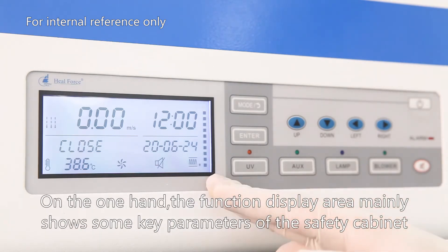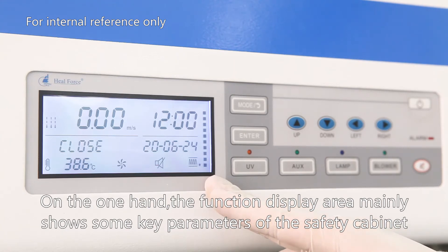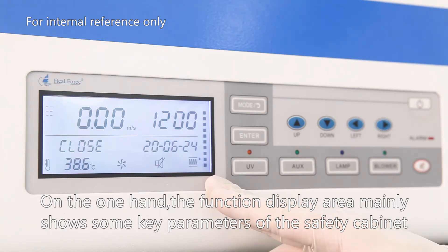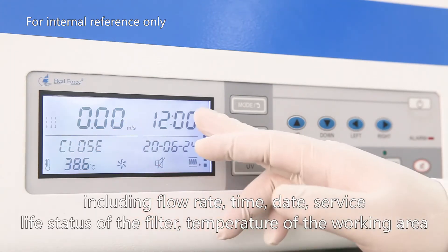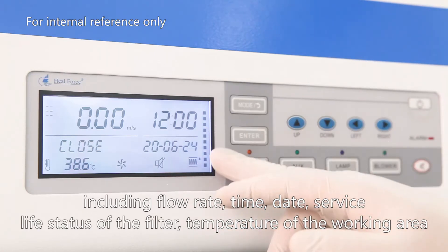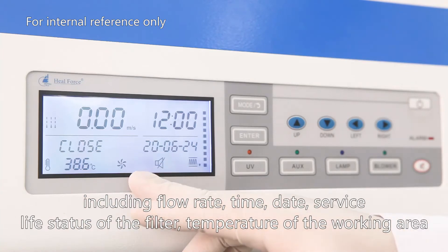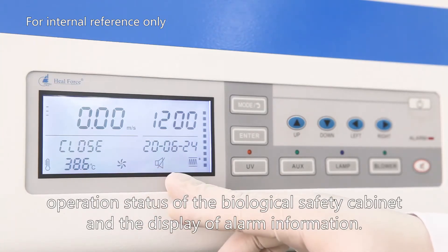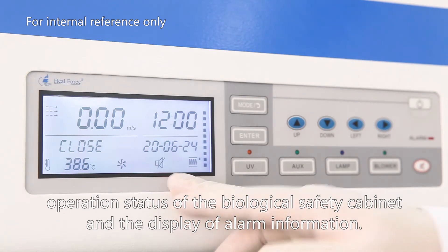The function display area mainly shows some key parameters of the safety cabinet, including flow rate, time, date, service, life status of the filter, temperature of the working area, operation status of the biosafety cabinet, and the display of alarm information.